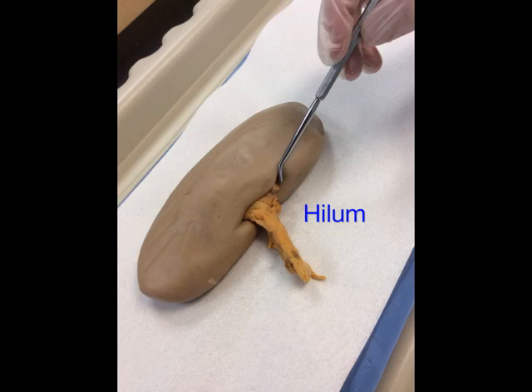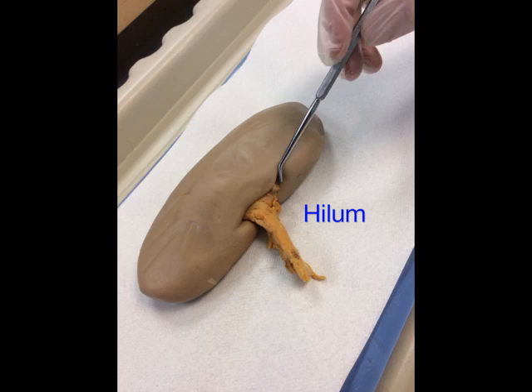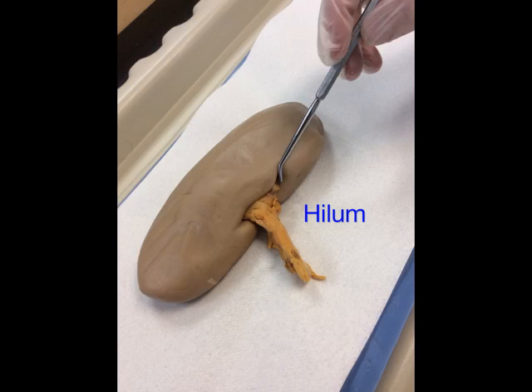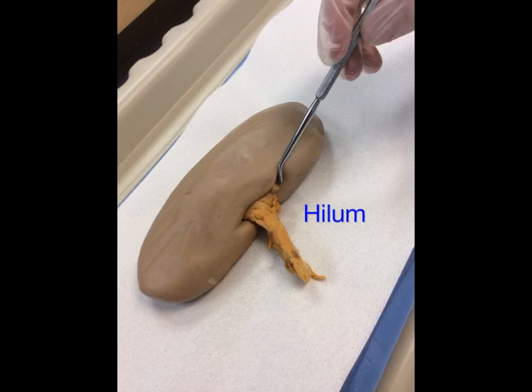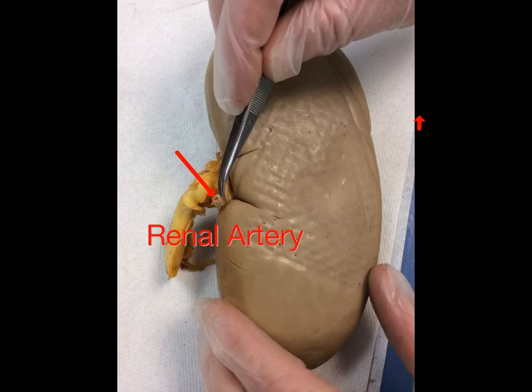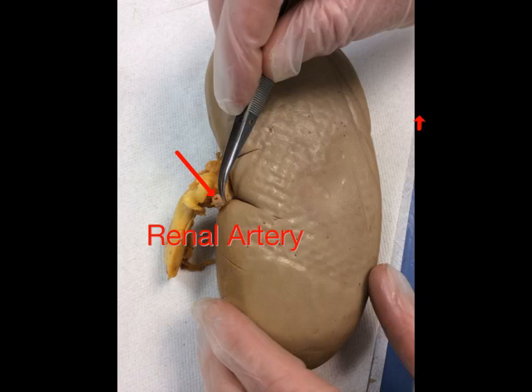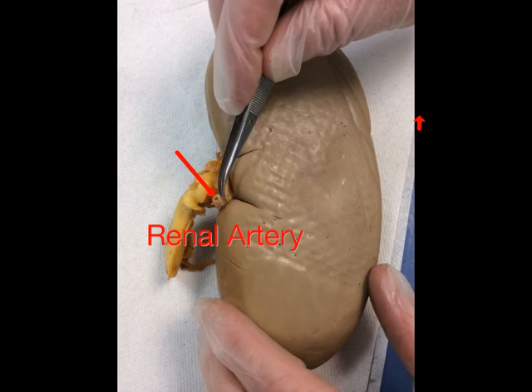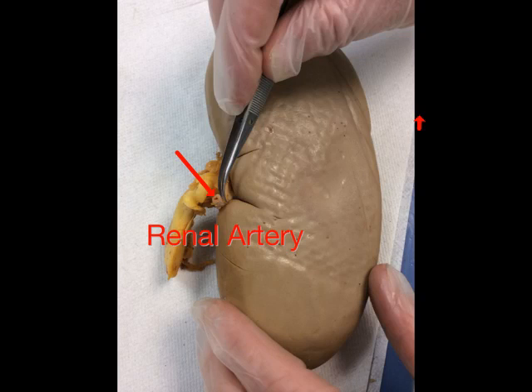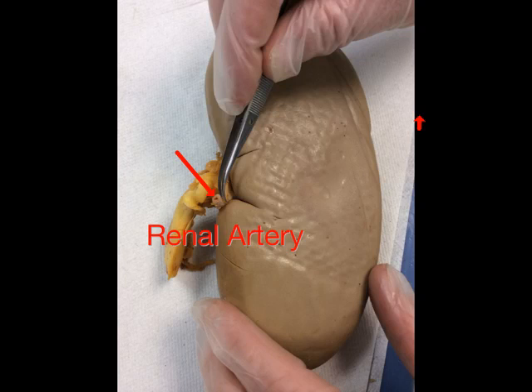The next external structure is the hilum, which is the indentation where vessels either enter or exit the kidney. Entering the hilum is a small blood vessel called the renal artery. Notice that the renal artery has a small diameter but a thick wall.